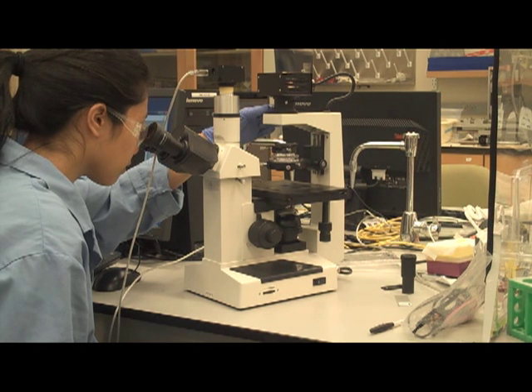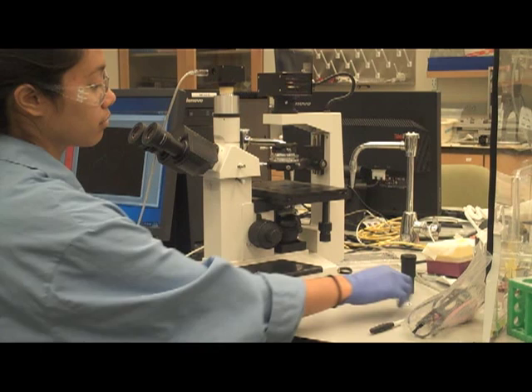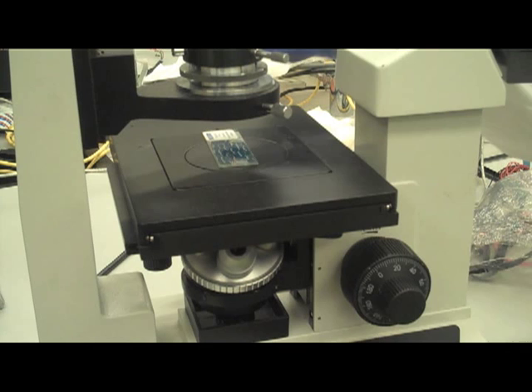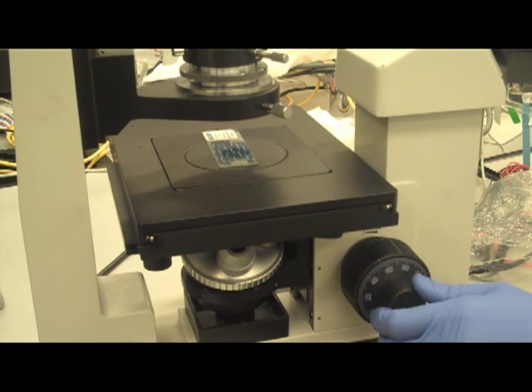Then turn the field diaphragm adjustment screw towards you to expand the field light image to the eyepiece view. Step 9: Place the specimen at the center of the stage and focus the specimen using the coarse focusing knob and the fine focusing knob to observe the image in bright field.